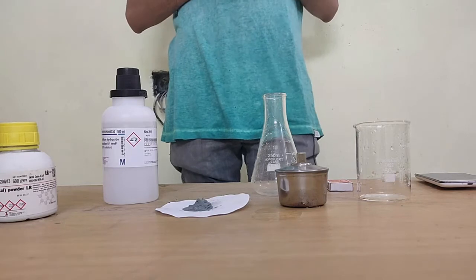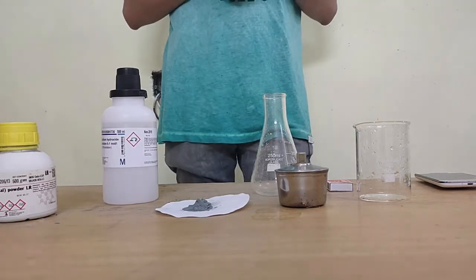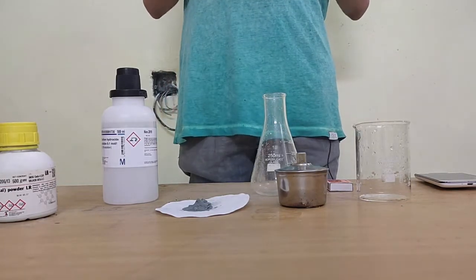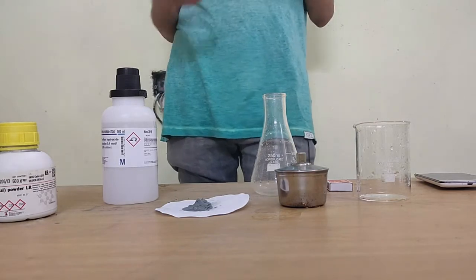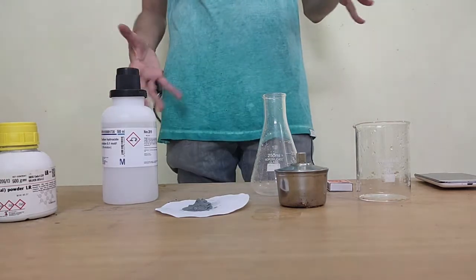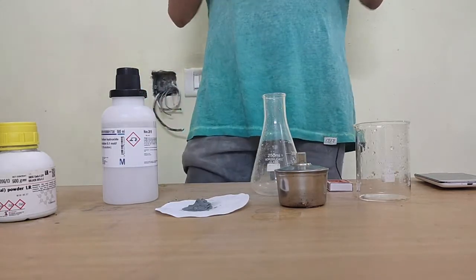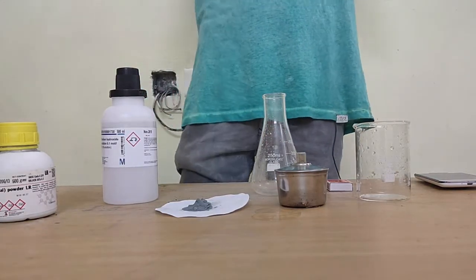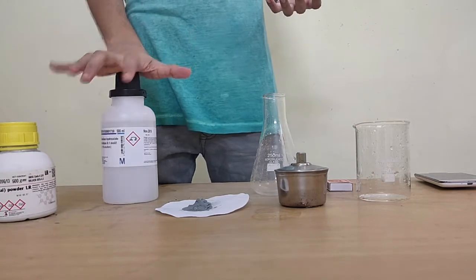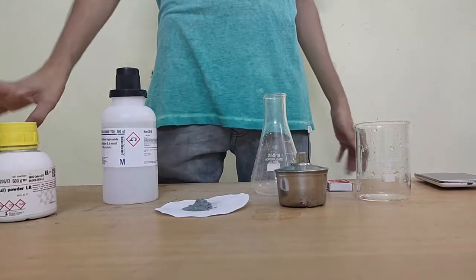Yesterday we looked at how an acid is going to react with a metal. Today we'll do a metal reaction not with an acid but with a base. My aim for today is to observe the reaction between a base and a metal.